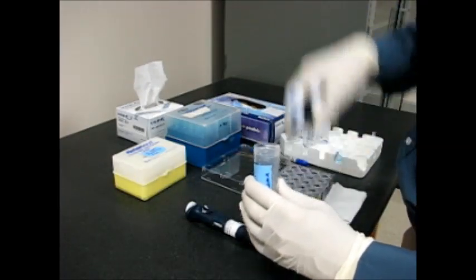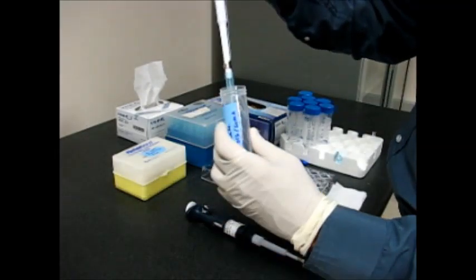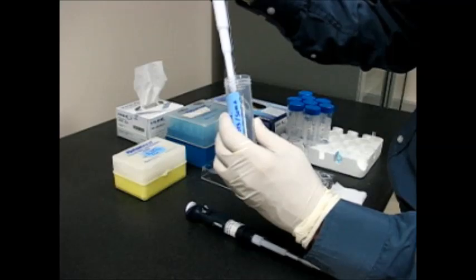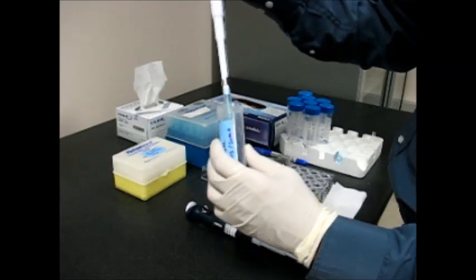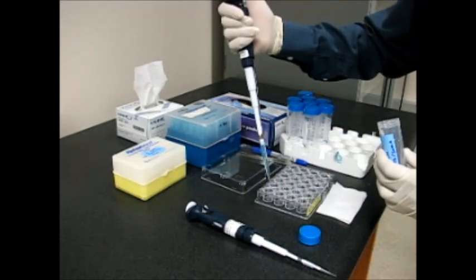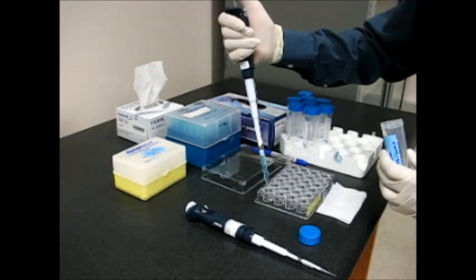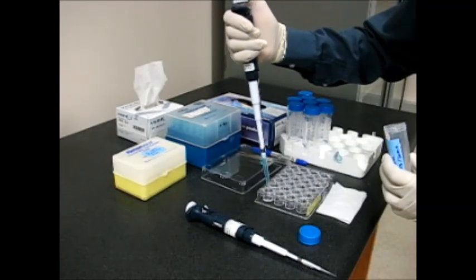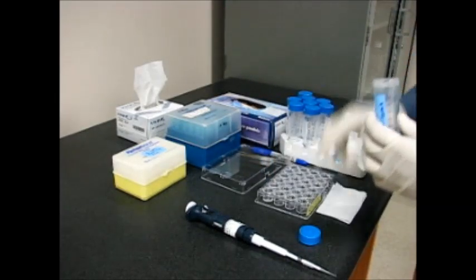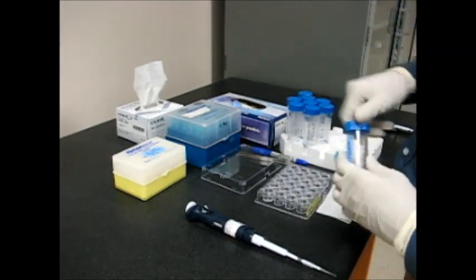In this case I am going to pipette 700 microliters of the precipitant solution. Pipette it inside the pipette tip and then transfer into the well A1 on the VDX plate which has been pre-greased. I have now transferred the precipitant solution.